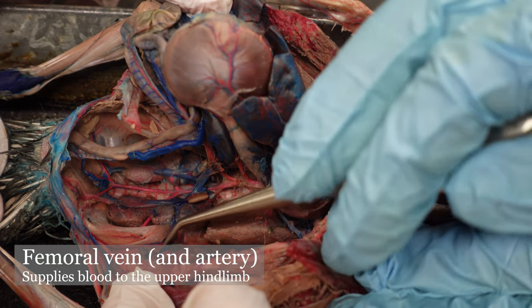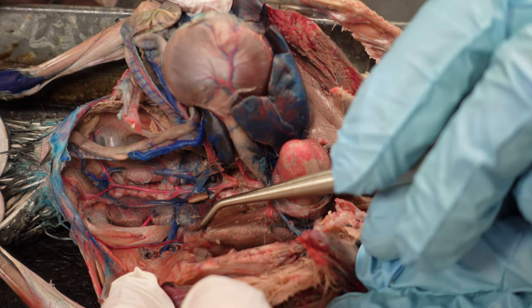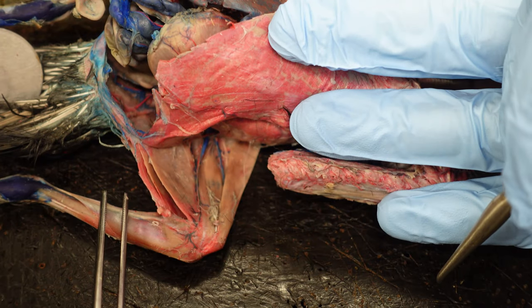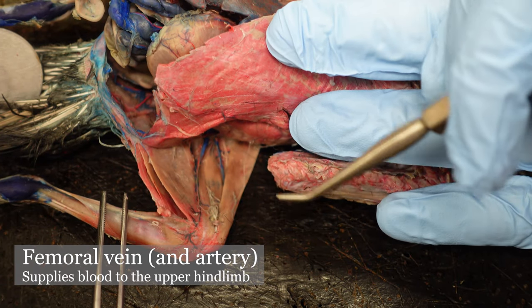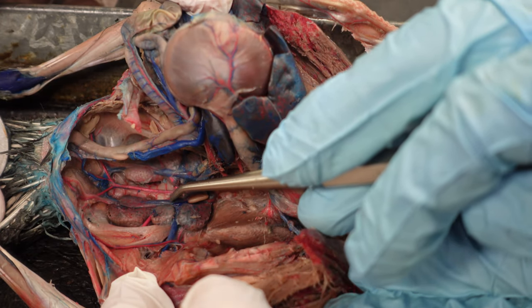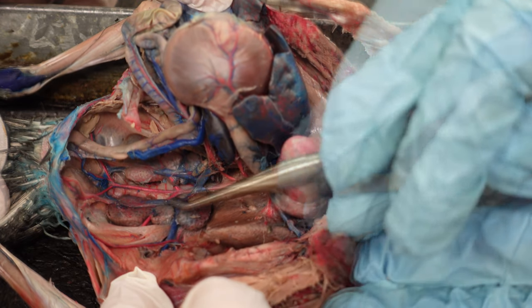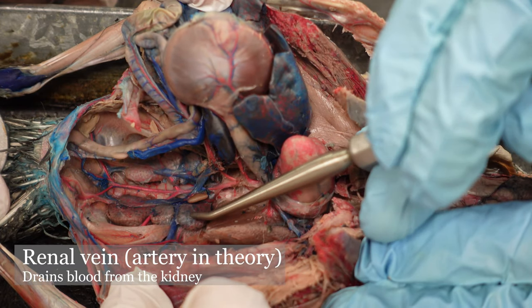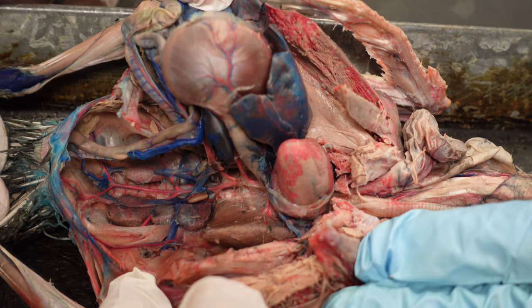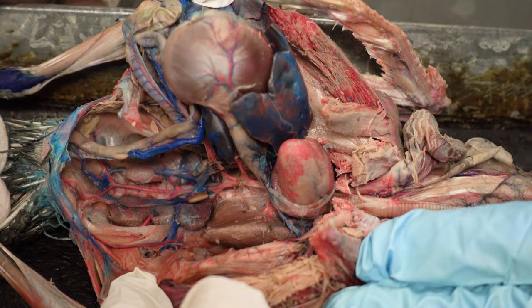There is some branching once you get out there — don't worry about learning what the branching is, we're not going to test you on that. Looking at the medial thigh of the pigeon, this is the femoral artery and vein. The other portion of that common iliac vein that heads caudally is the renal vein. There are going to be three renal veins — we're not having you identify or distinguish between them, but just be aware that because there are three lobes of this kidney, they have three renal veins.